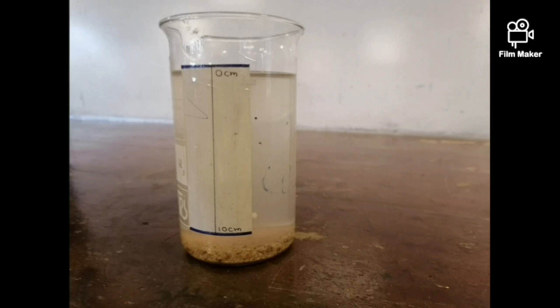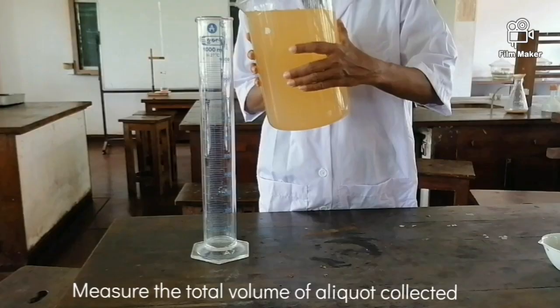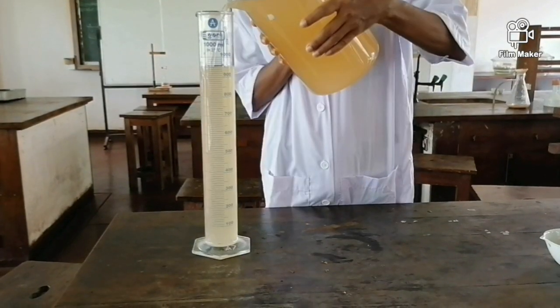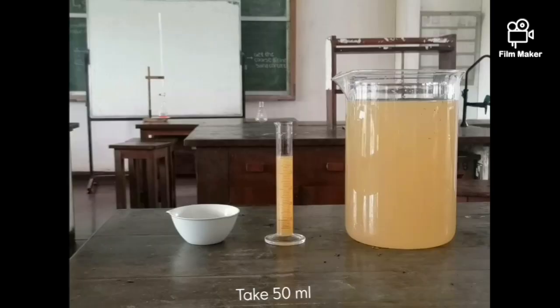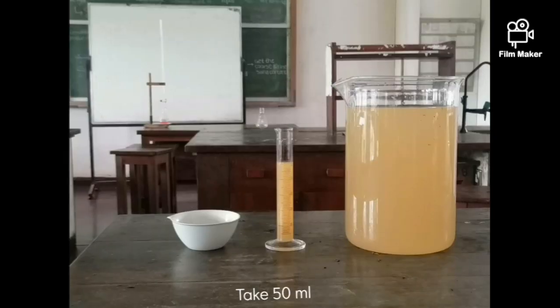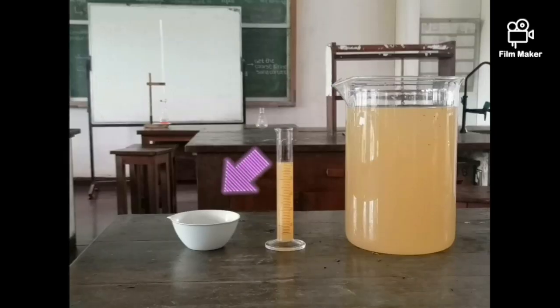Now record the total volume of clay aliquot collected. A 1-litre measuring cylinder is used to measure the total volume. Then take 50 ml of aliquot and transfer it into an evaporating dish.